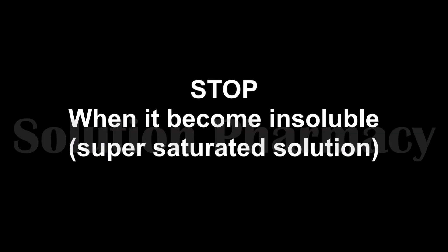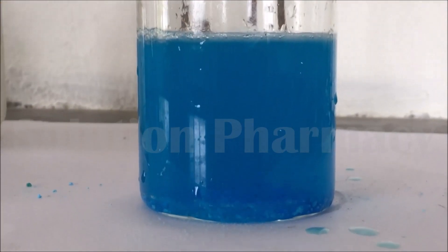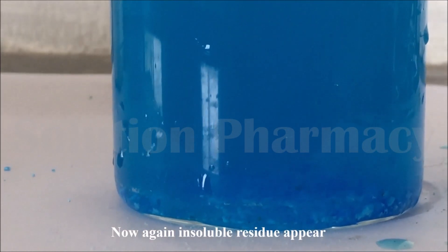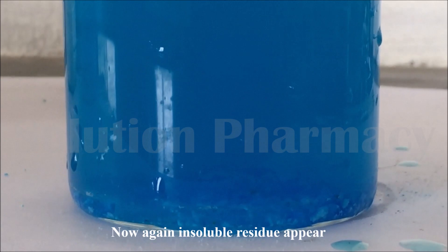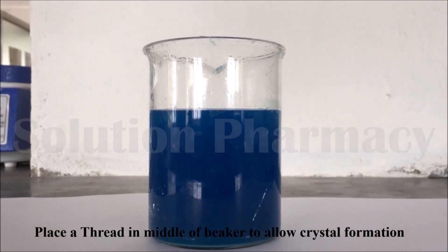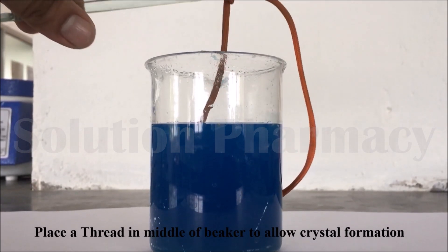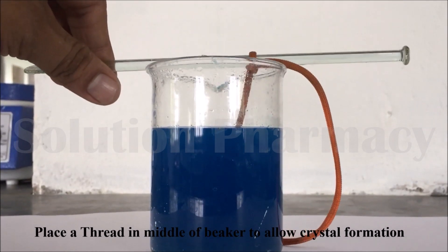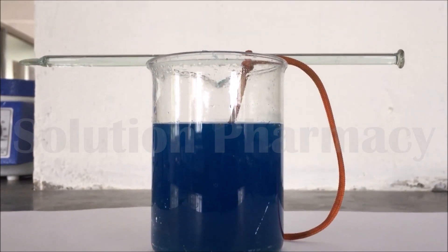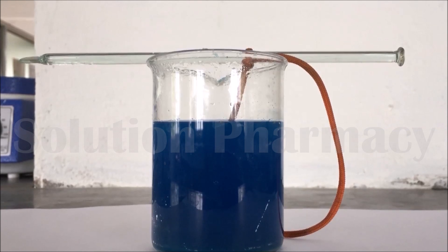Stop adding copper sulfate. You can see the insoluble copper sulfate left at the bottom of the beaker — this is now the super saturated solution of copper sulfate. To allow nucleation, place a thread in the middle of the beaker with the support of a glass rod. Now keep this beaker aside without disturbing it for the crystallization process.